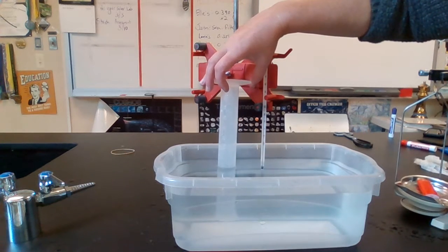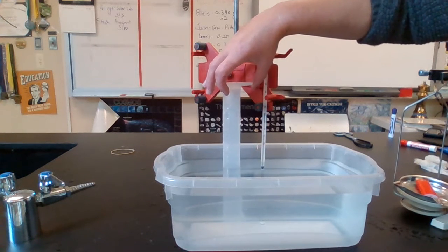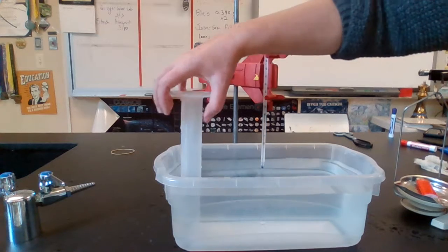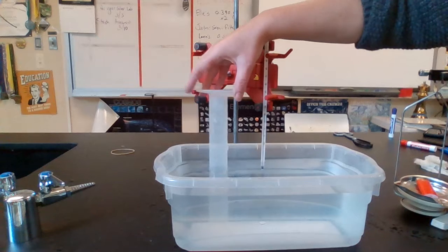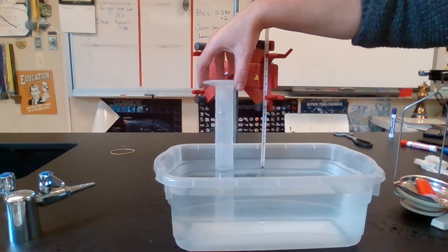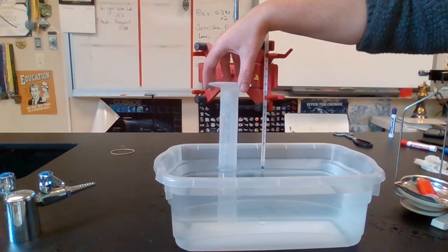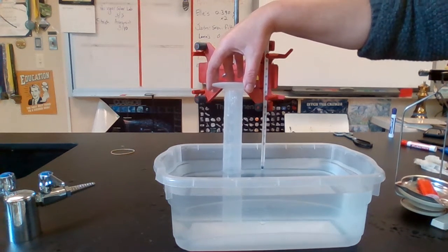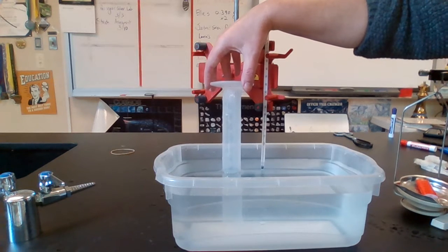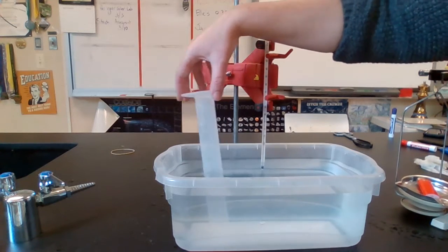And I have collected 81.5 milliliters of gas in there. I'm going to adjust that a little bit, because I am going to make sure that the water level in the tub matches the water level in the tube, because that's going to make sure that the pressures are equal to each other. And that adjusts down to about 81 milliliters. Again, all of this data is going to be in Schoology, but the volume of butane gas I collected was 81 milliliters.